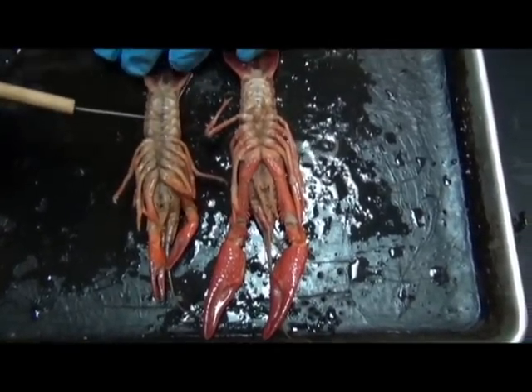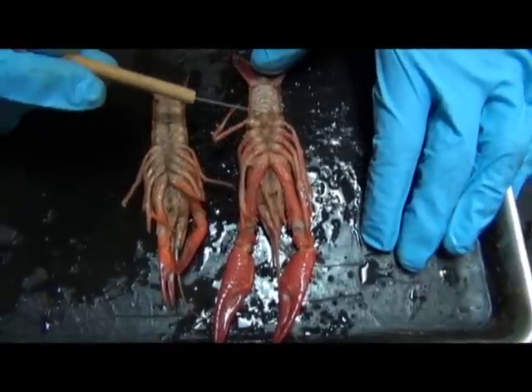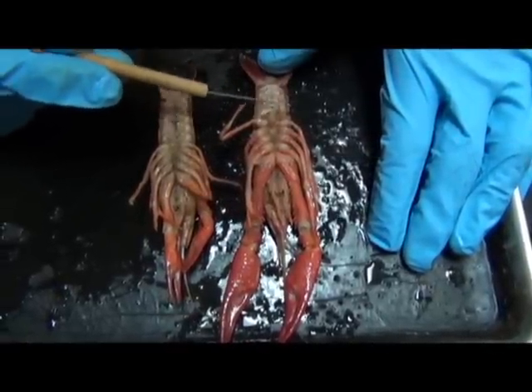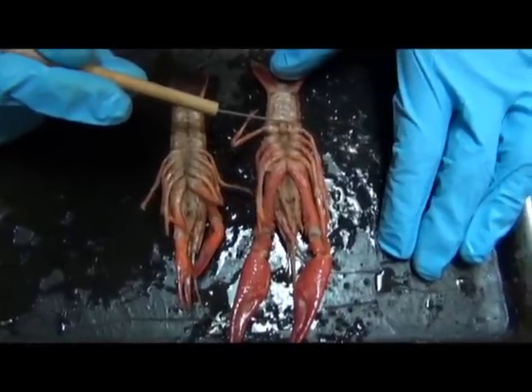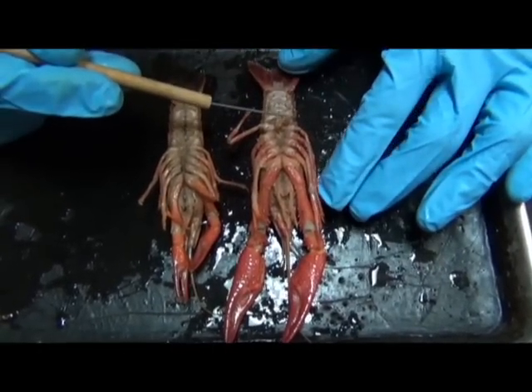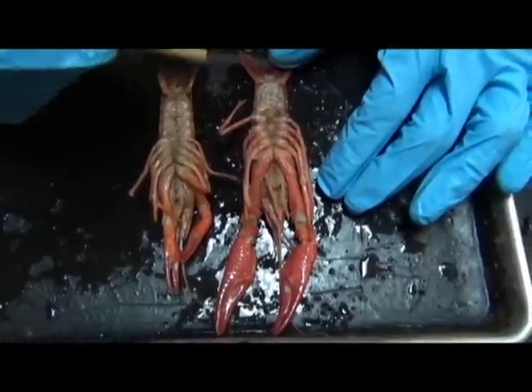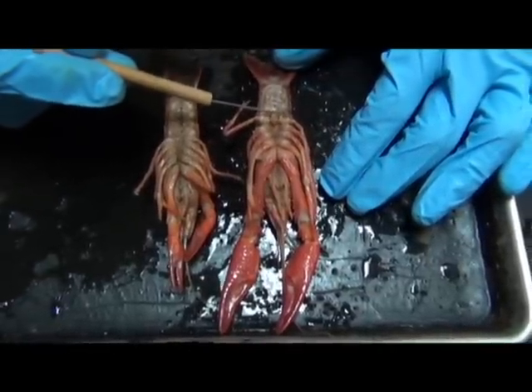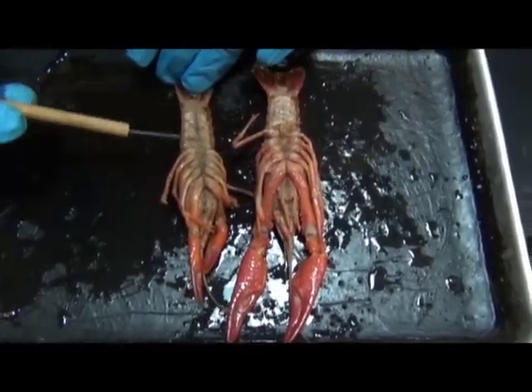Okay, so if ever you wanted to know the difference between a male and a female crayfish, or even a lobster, just flip it over and pay close attention to the swimmerets and note what the anterior swimmerets look like, or what their texture is like relative to the swimmerets that are more posterior. If they are different, with the ones anterior being stiffer, you have a male. If they're all the same, you have a female.